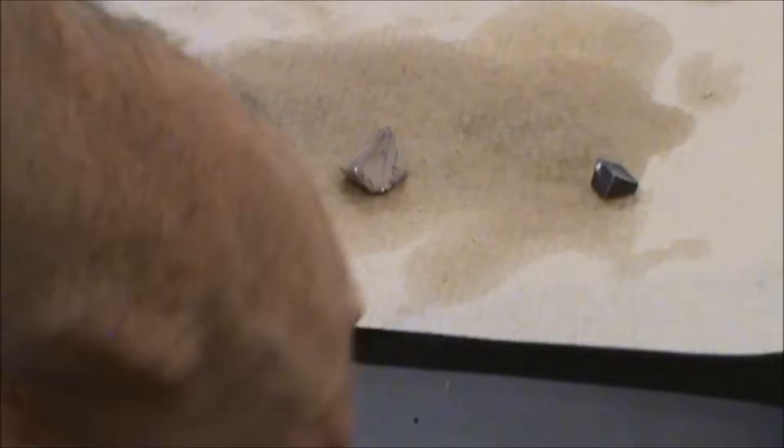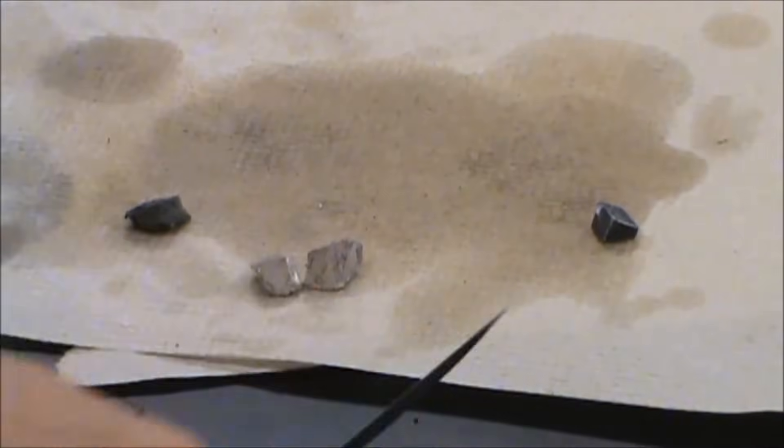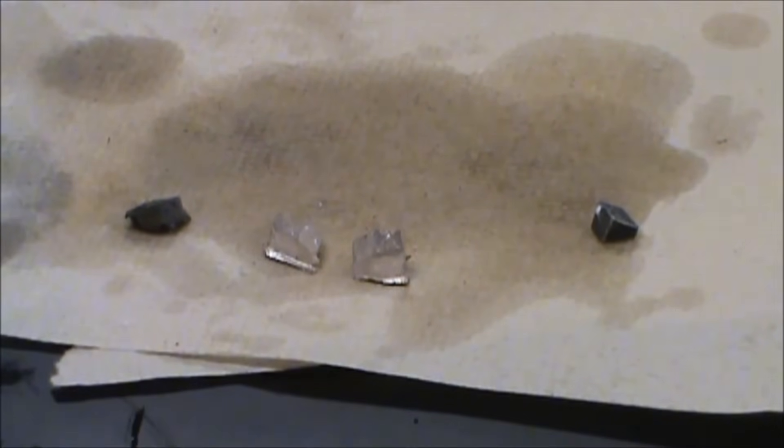Here I'm working with some lithium metal, very difficult to cut. I've got a piece of sodium here, pretty easy to cut. You notice when I cut through that, the fresh sodium is very shiny compared to the rest.